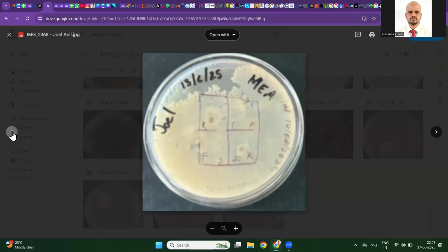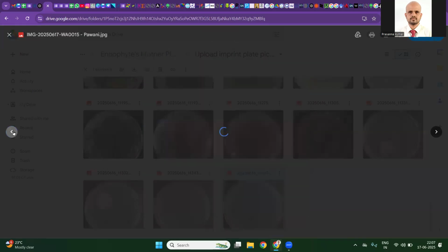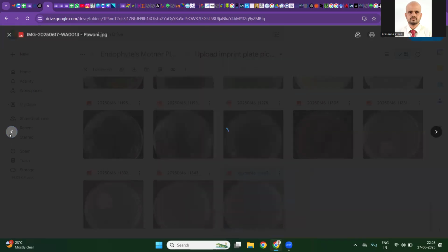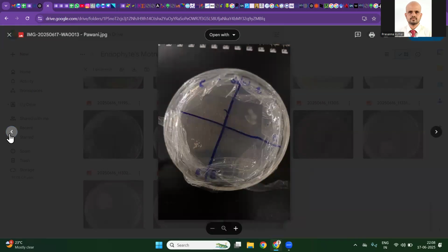Again, swarming Bacillus, probably megaterium; the branch thickness will tell us whether they are megaterium or cereus. Cereus will have relatively finer branches. But that's not the point. The point is sterilization is not effective. That's why I say condensation water is already there, which is blocking our view. I can see Bacillus here. So sterilization again is not very effective here.